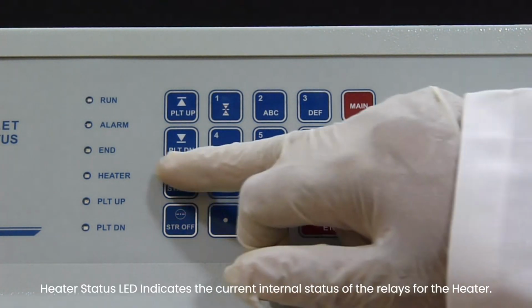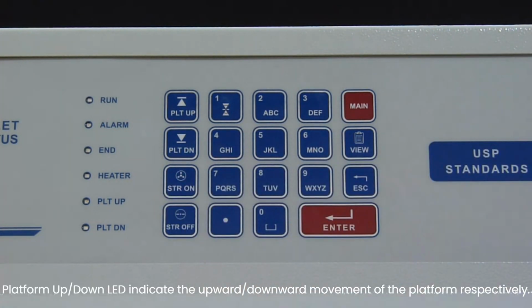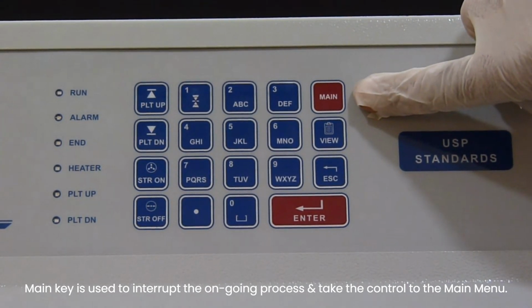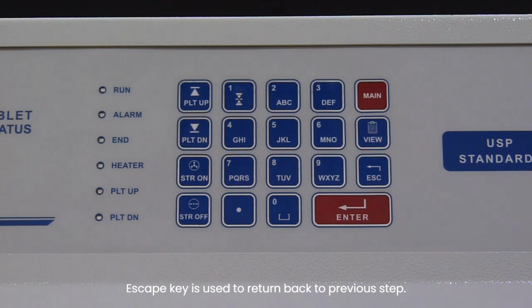Heater status LED indicates the current internal status of the relays for the heater. Platform up-down LED indicates the upward-downward movement of the platform respectively. Main key is used to interrupt the ongoing process and take the control to the main menu. Escape key is used to return back to the previous step.